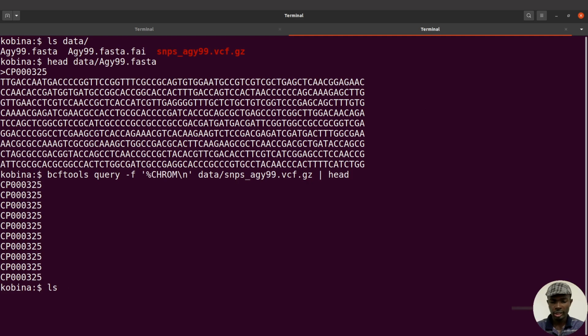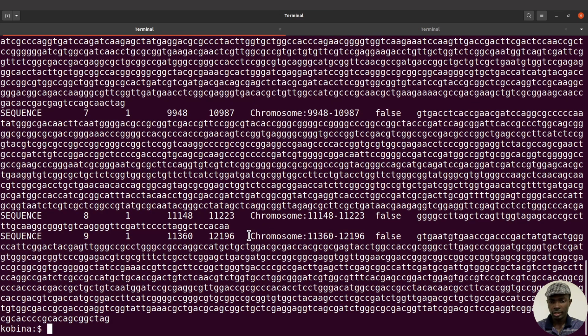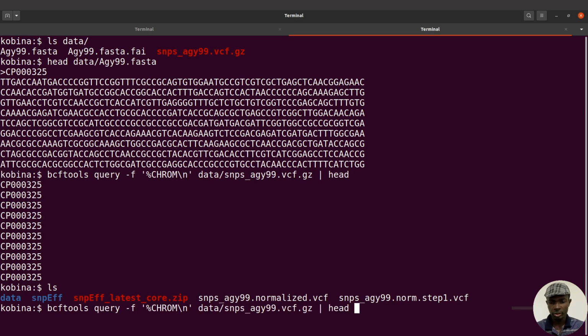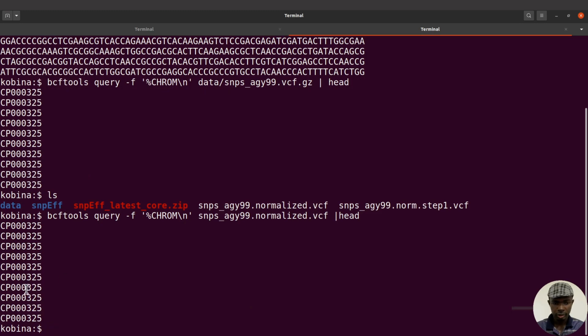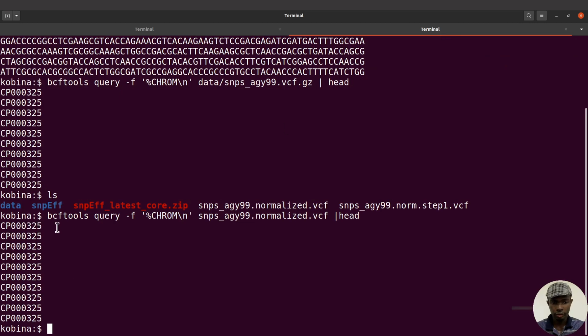The VCF file which we use, that's this one here. So SnpEff expects to see this chromosome name in this VCF file. Okay, it can't see it there. So this one obviously will have the same accession ID as here. Let me just reissue that command, but this time I'll just use the input, that's normalize.vcf, and do a head. All right, so we have that here. Because of the differences, here is the word chromosome, and here it's CP000325. And so this is what we have to resolve. This is why we had that issue.